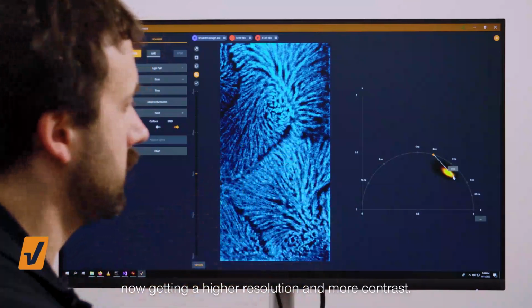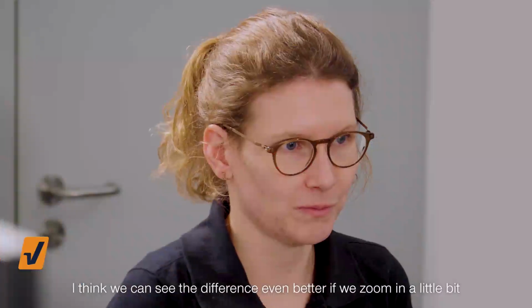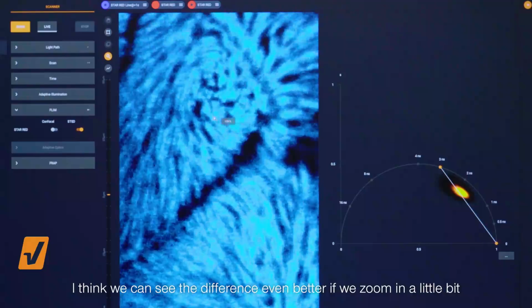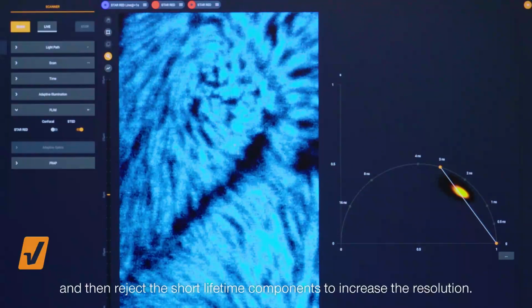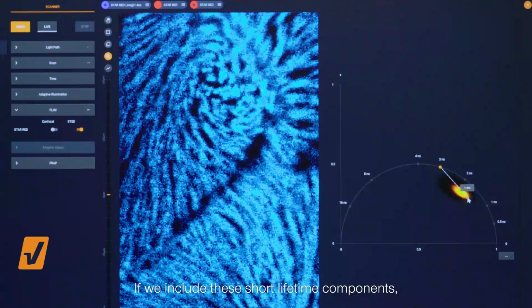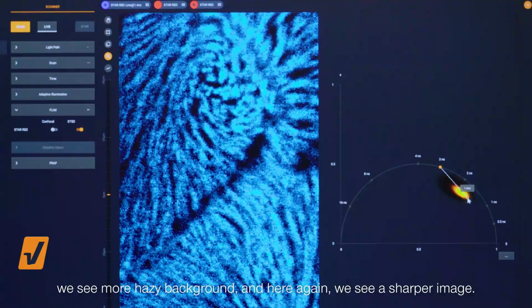and you can see in the image that you're now getting a higher resolution and more contrast. I think we can see the difference even better if we zoom in a little bit and then reject the short lifetime components to increase the resolution. I think we can see the resolution going up. If I include these short lifetime components, we see more hazy background, and here again we see a sharper image.